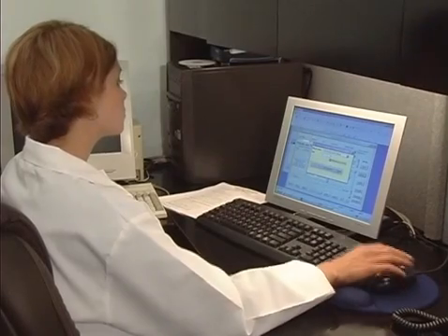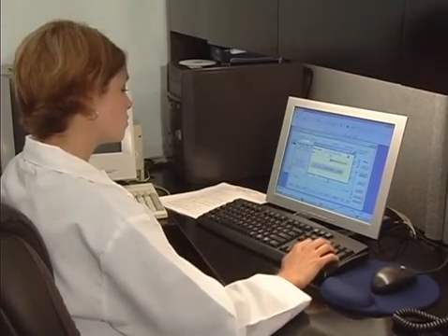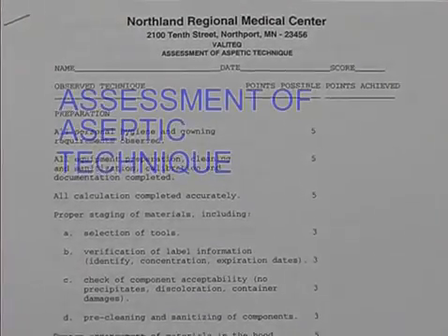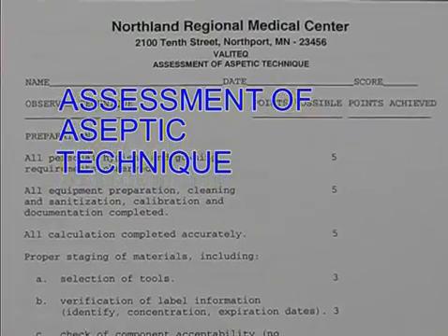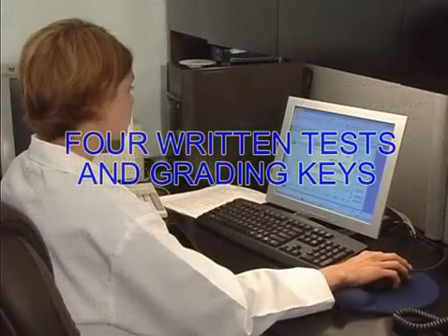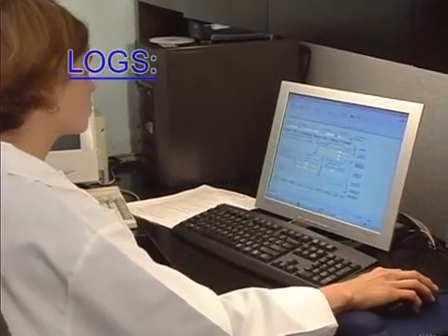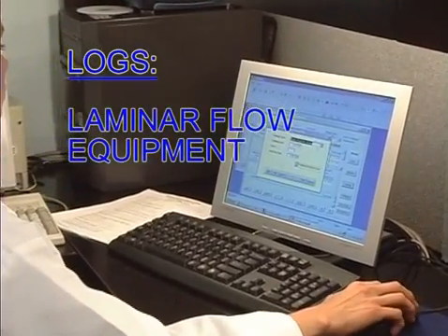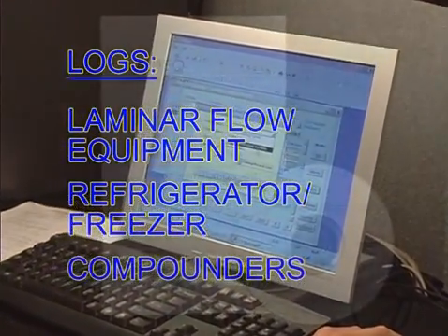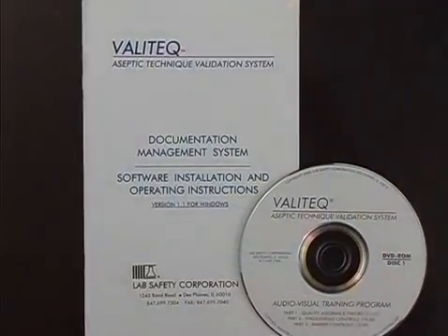The DMS also provides validation summaries — a report of all personnel due for revalidation and the dates due — along with the required assessment of aseptic technique forms, and four different written tests and grading keys. Equipment logs for laminar airflow equipment, refrigeration, and compounders are also printed from the DMS.